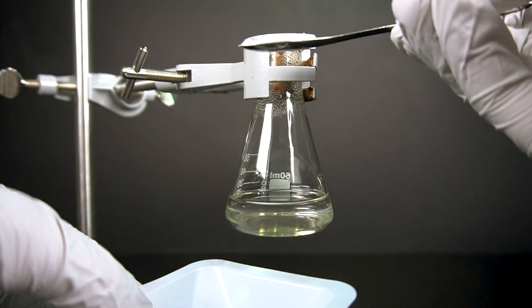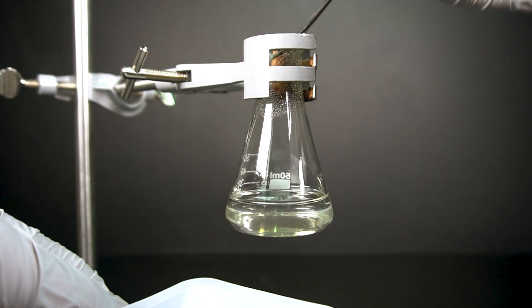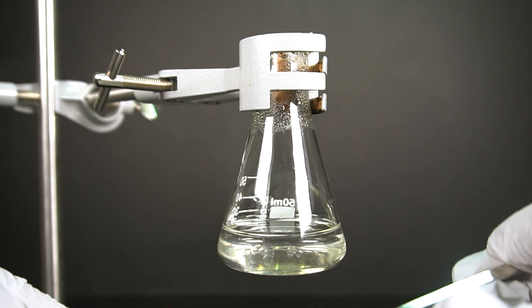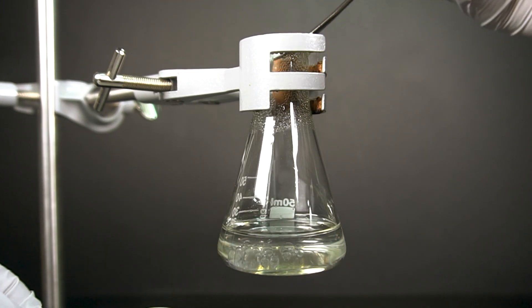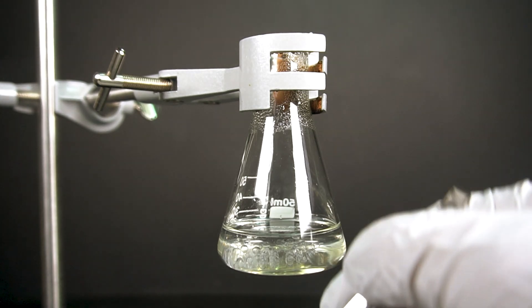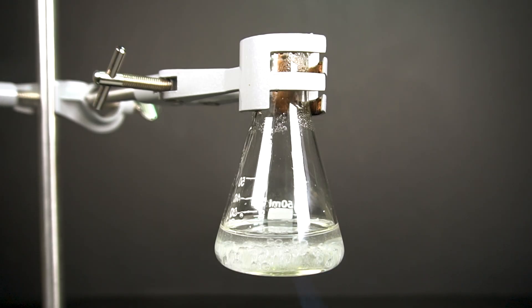We will slowly add the crushed up silica gel from earlier. The goal here will be to get everything to dissolve, but there is a caveat. If the beads aren't crushed up enough, they take a lot longer to dissolve. Also, getting the silicate to dissolve, it's recommended that the solution is near boiling.